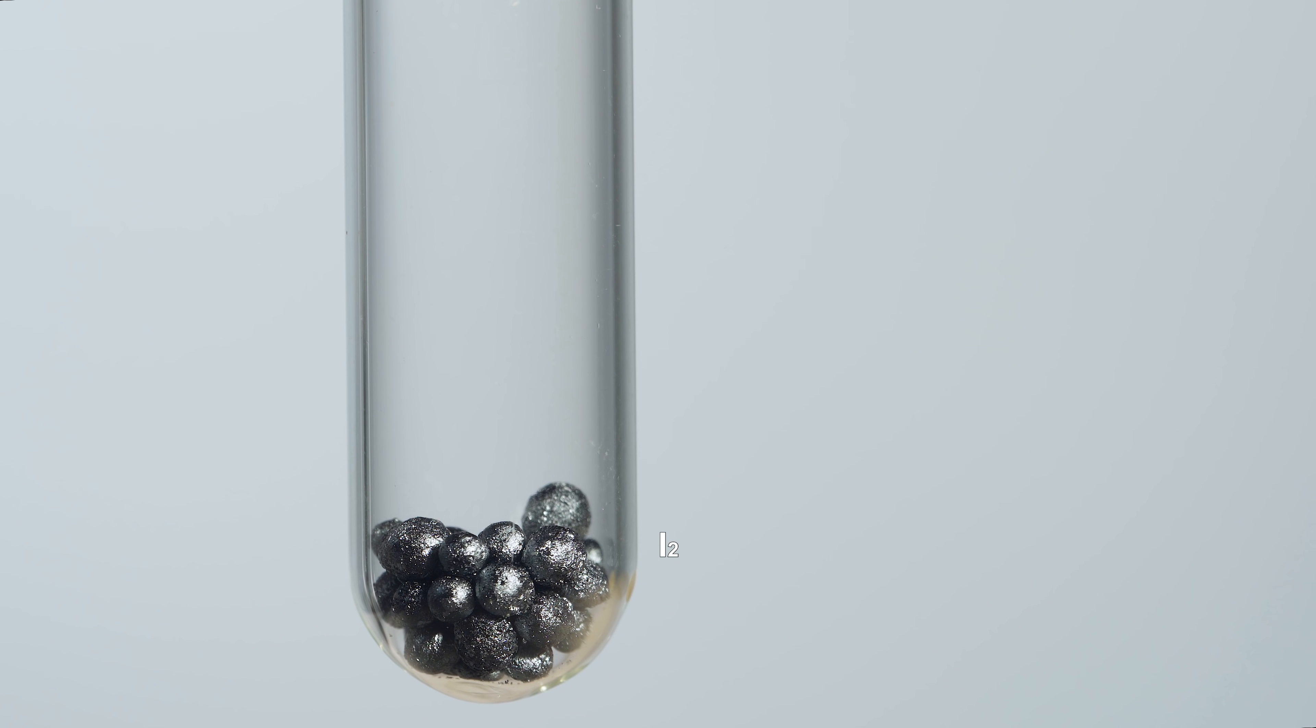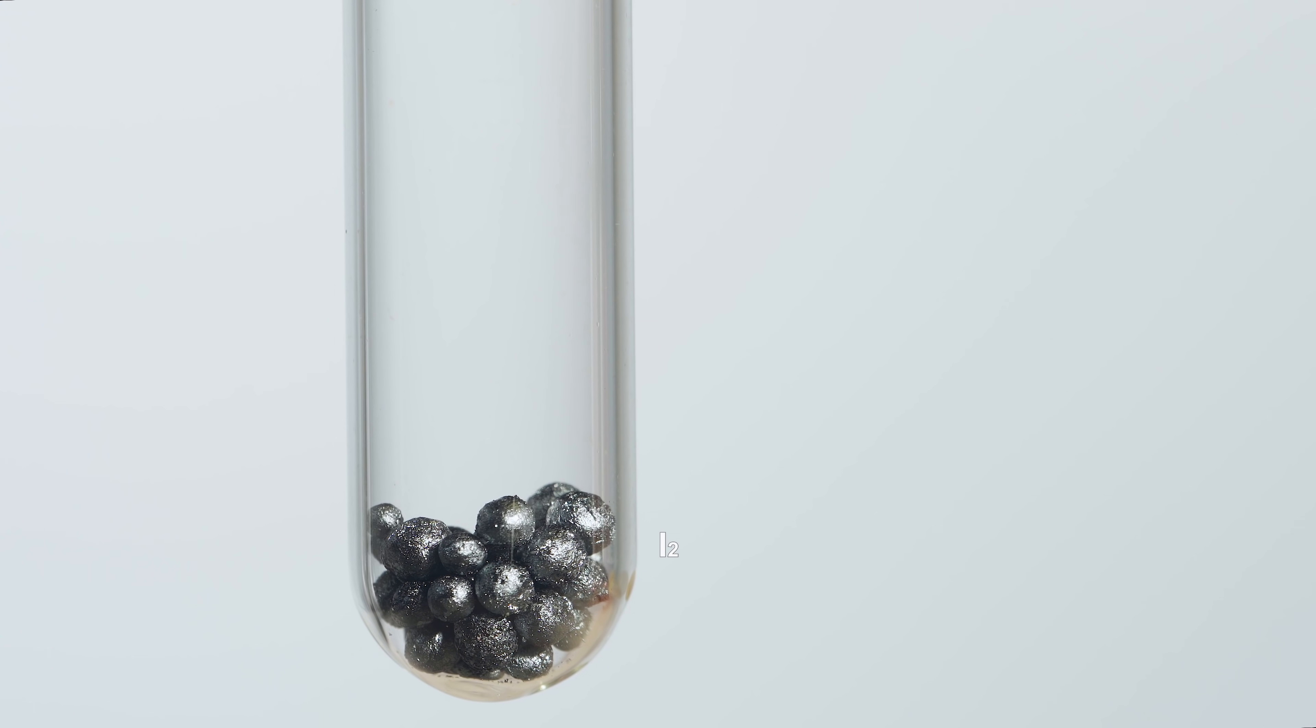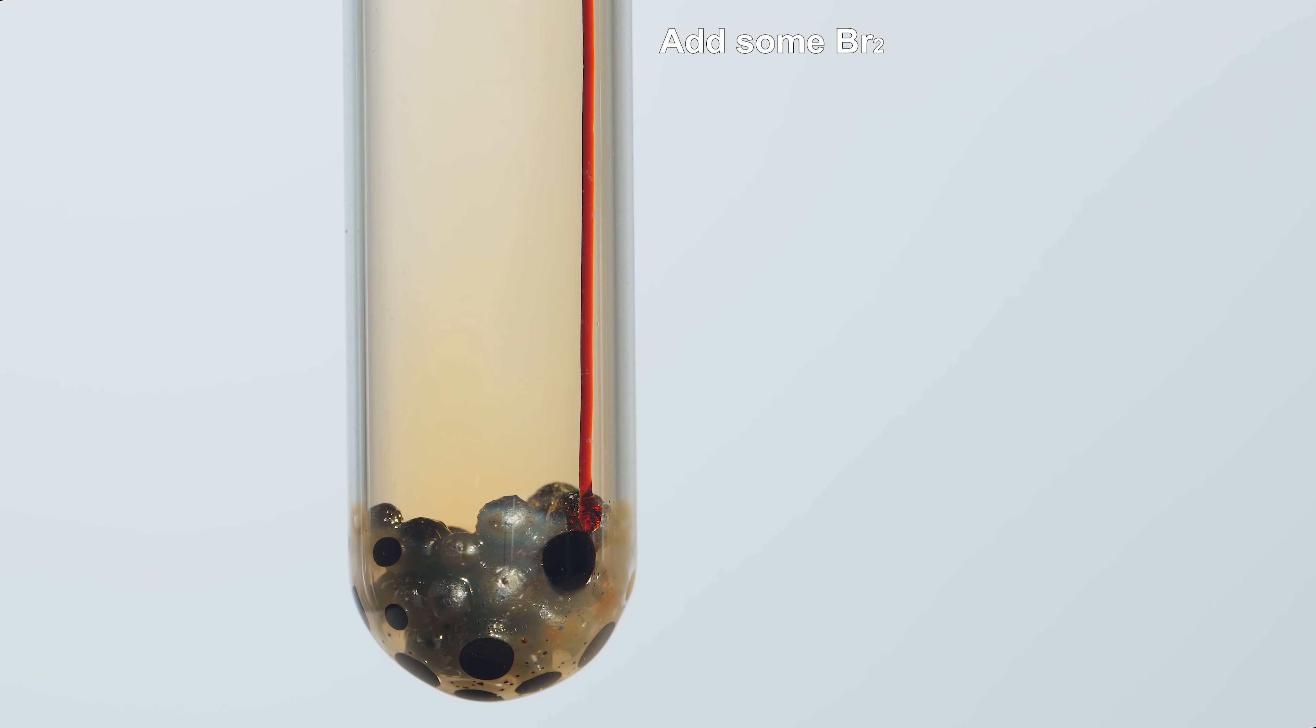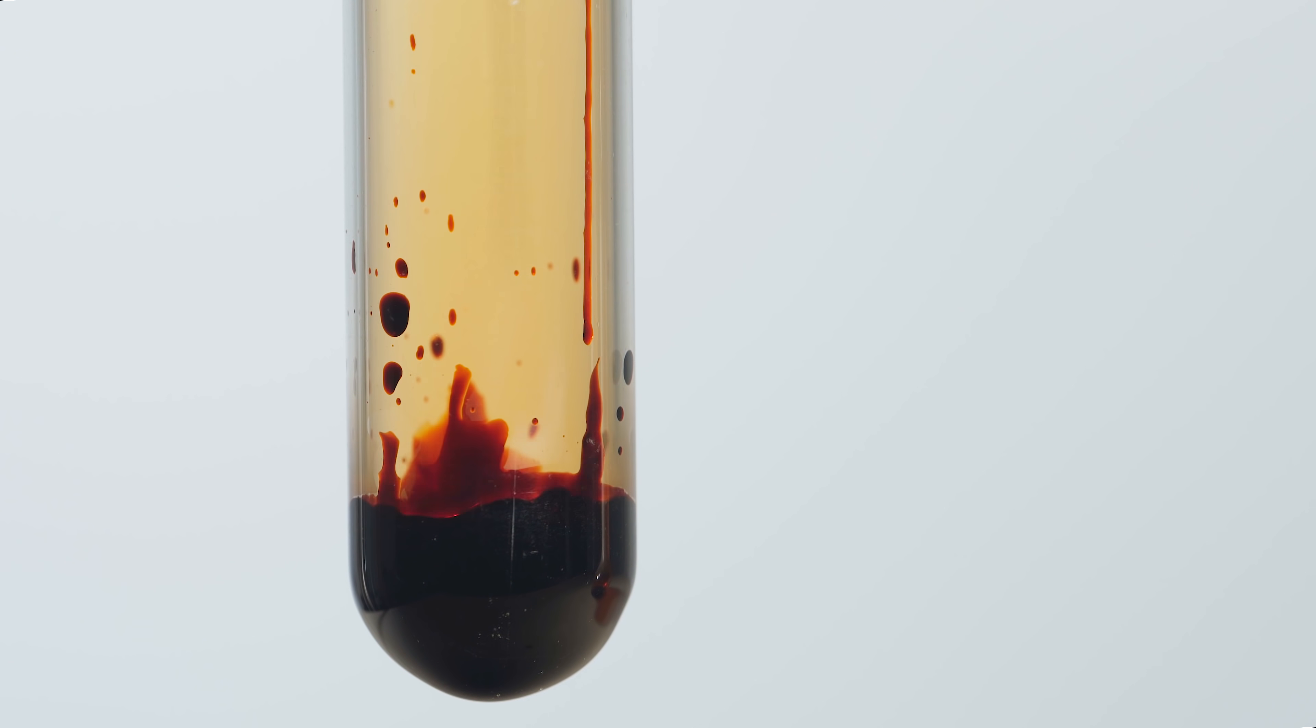Hey guys! Heating iodine with bromine up to the point of complete liquefaction of the whole mass and its later cooling results in the formation of an interhalogen compound known as iodine monobromide.